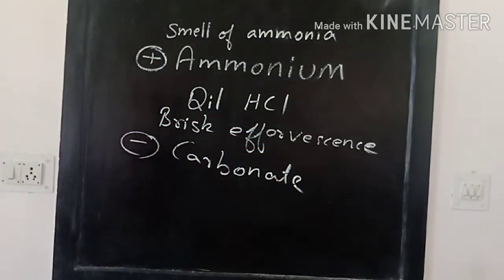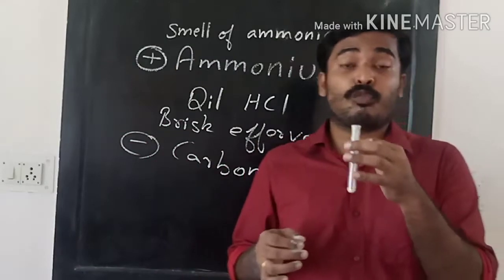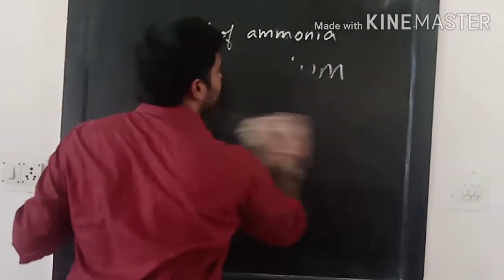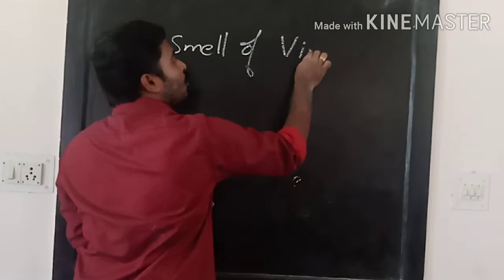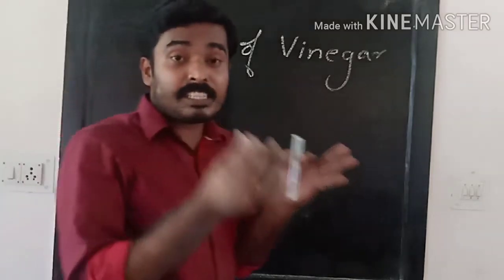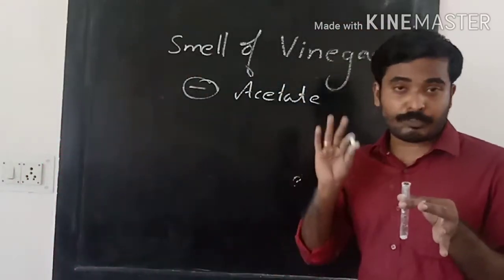Next, we have been given a salt here. This also I will dissolve in water. One more thing, this salt has a smell of vinegar. This is our second salt. If there is a smell of vinegar, that's a very easy way to identify the anion acetate. The anion may be acetate. Anyway, we are not going to confirm it now.